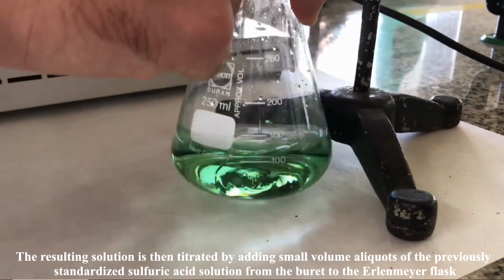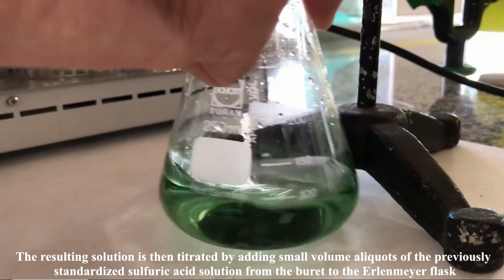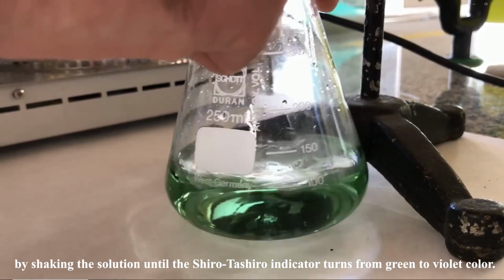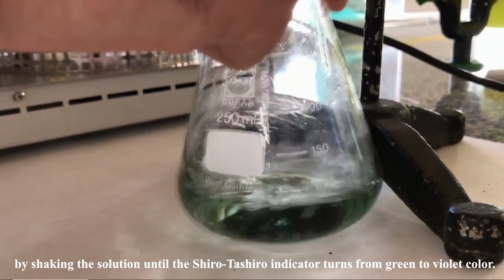The resulting solution is then titrated by adding small volume aliquots of the sulfuric acid solution from the burette to the Erlenmeyer flask, shaking the solution until the Tashiro indicator turns from green to violet color.